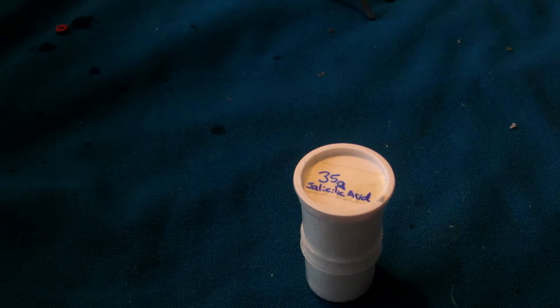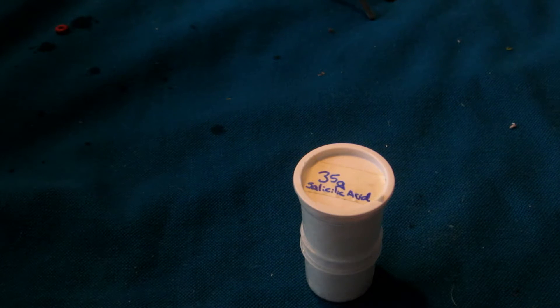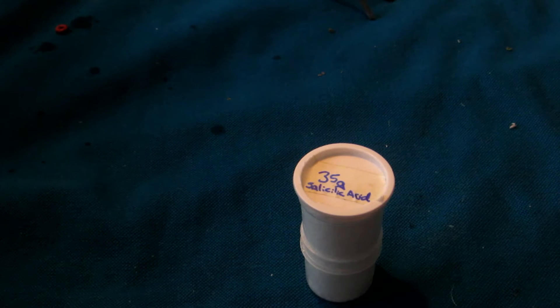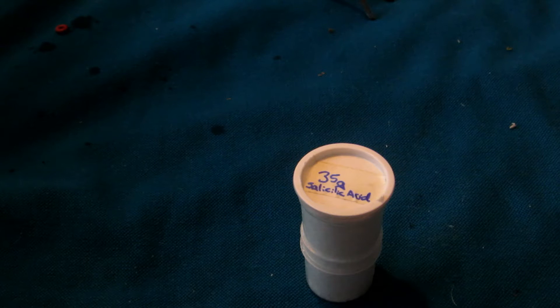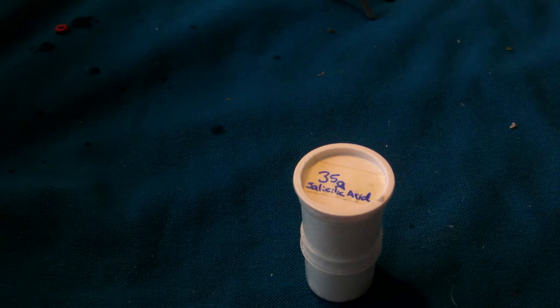To create phenol, it's actually quite simple. It's the decomposition of salicylic acid, which forms phenol and carbon dioxide. It's a decarboxylation reaction.